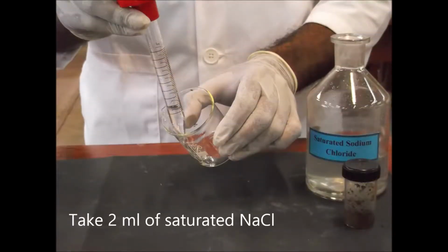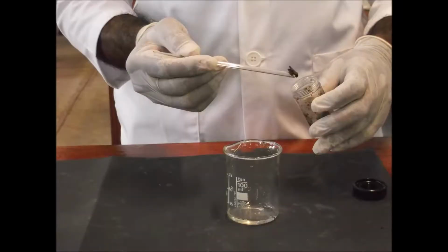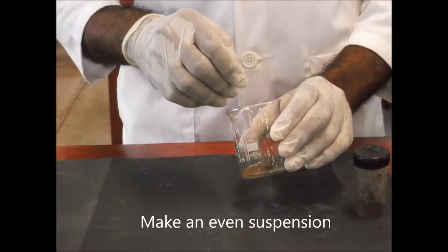To start, take 2 ml of saturated sodium chloride solution and add it to a beaker. Then take about 1 gram of feces and add it to the sodium chloride solution in the beaker. You must mix the feces with the sodium chloride solution thoroughly to make an even suspension.